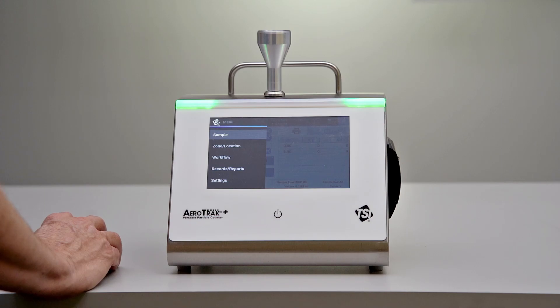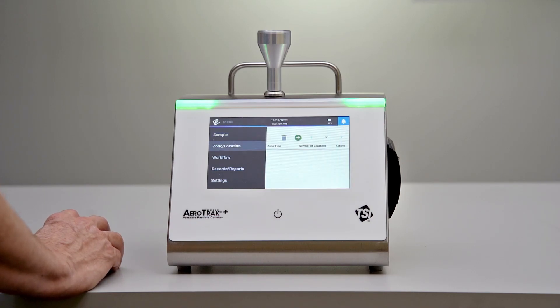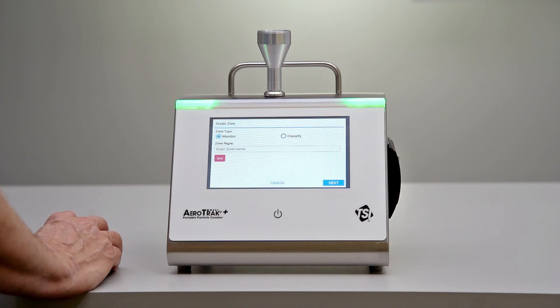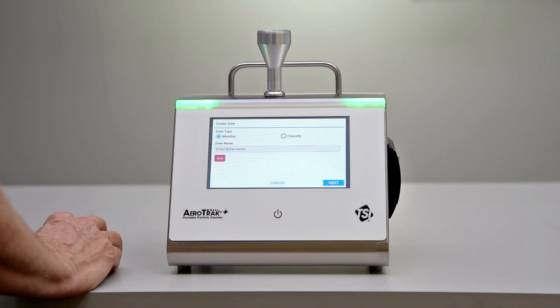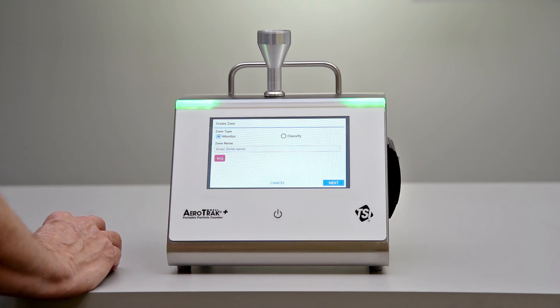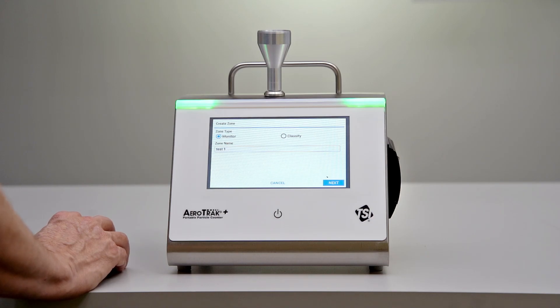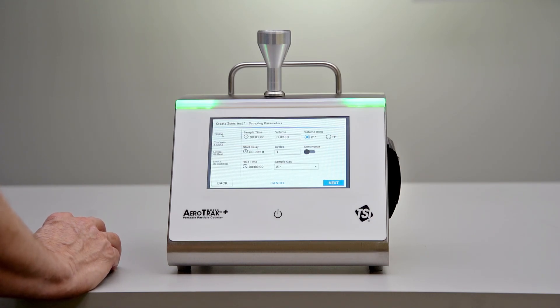To set up a new zone, we go to our zone menu, click on the green plus button, and select the type of zone — today we're going to do a monitor zone. We can type in the zone name, or if there's something in the memory we can pull it in. I'm just going to grab 'test' and use that as the name of our zone.